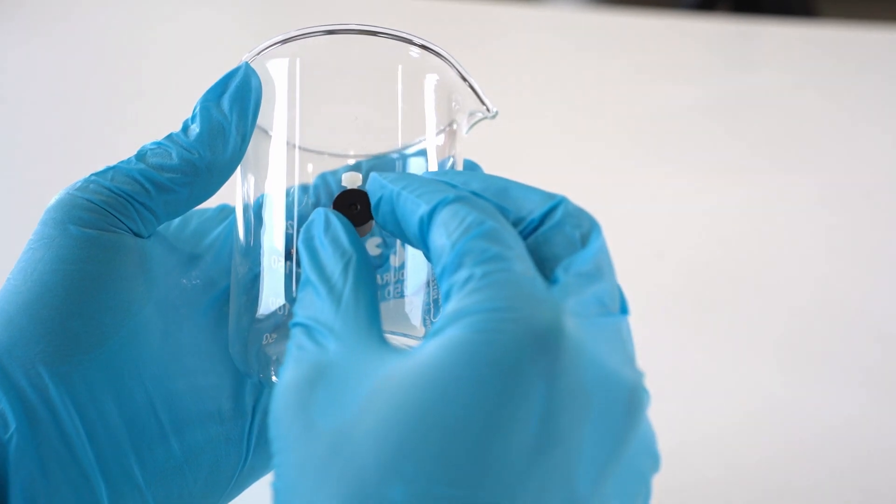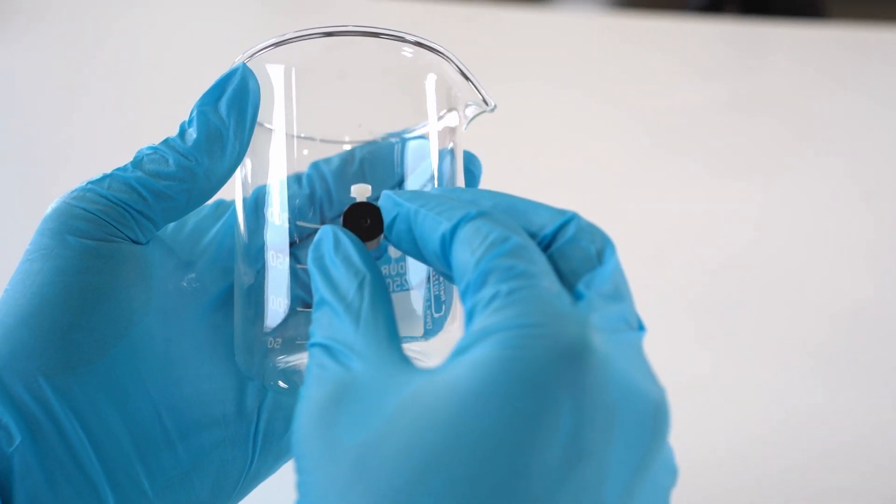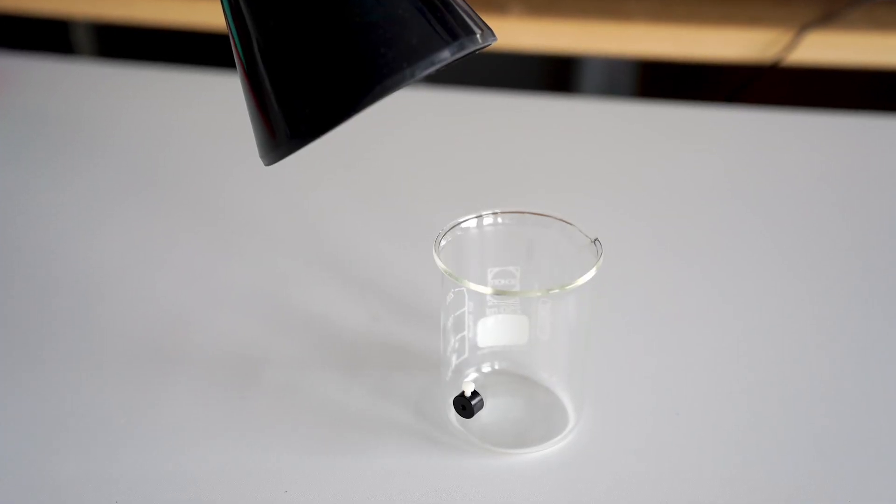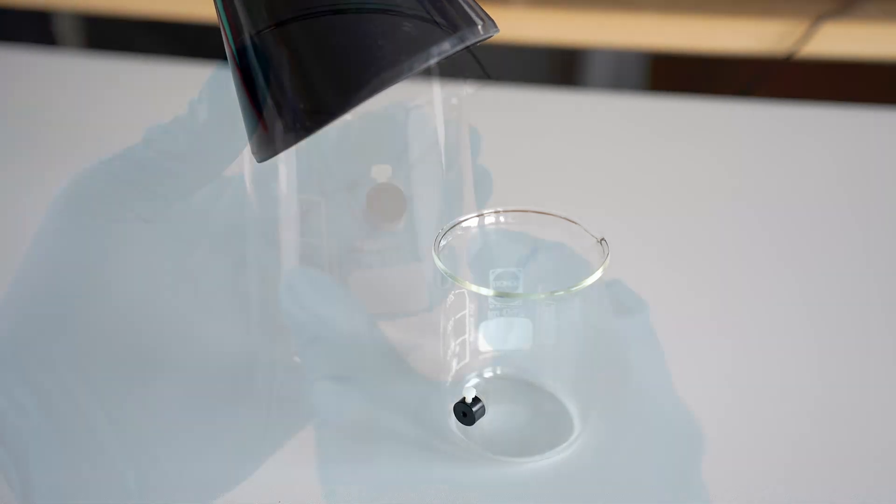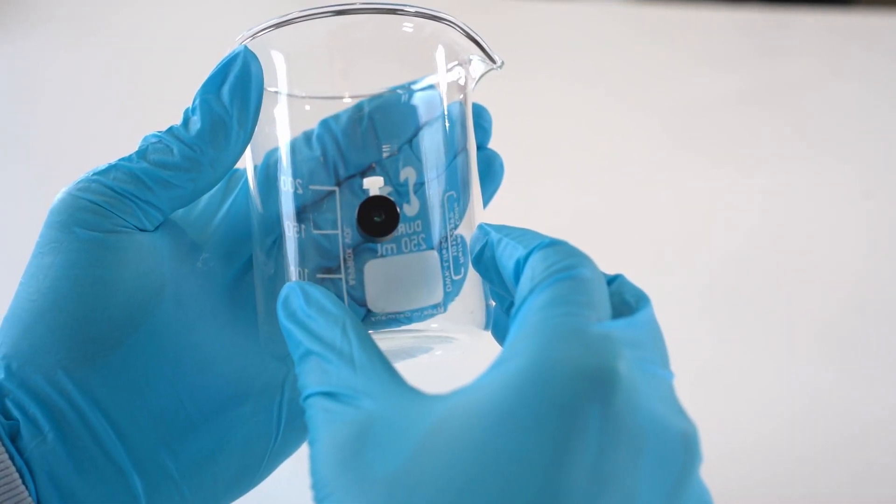Let the fixed sensor spot and spot adapter dry for at least 12 hours. Ensure good ventilation as acetic acid is released during drying. Do not use it before the glue has completely dried.